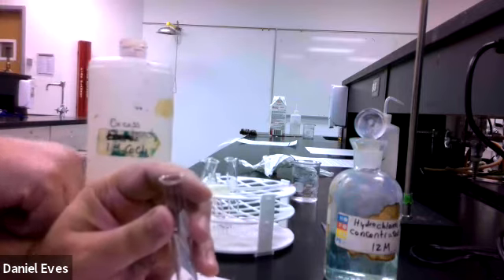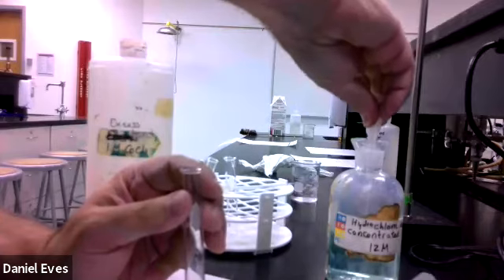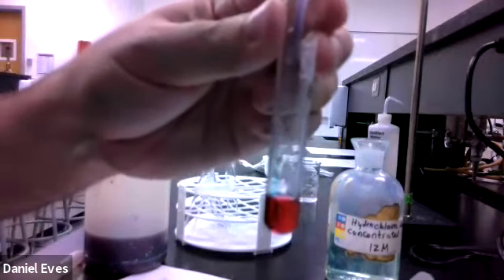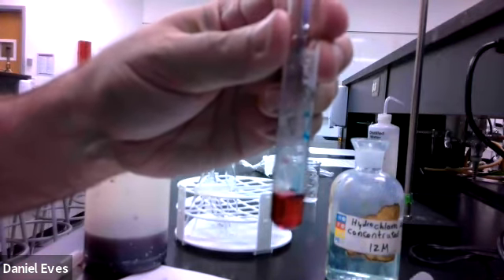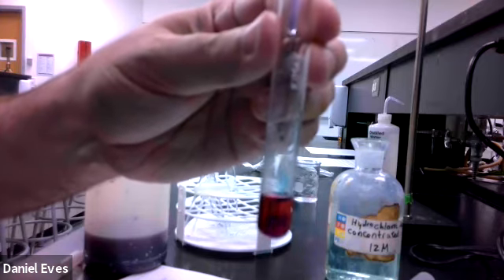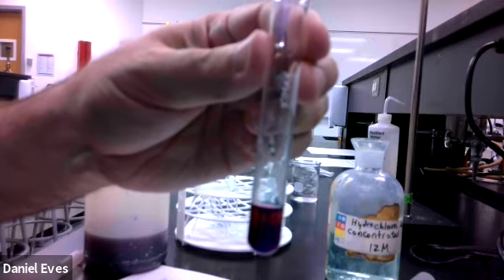But to get the waters away from the cobalt ion, we need to flood this solution with a bunch of chloride ions. And the way that we can do that is with concentrated hydrochloric acid. So we're going to go ahead and put a couple of drops of that in here so you can see what happens when we add concentrated hydrochloric. 3 drops, 4 drops, 5, 6, 7, 8, 9, 10, 11, 12, 13, 14, 15.